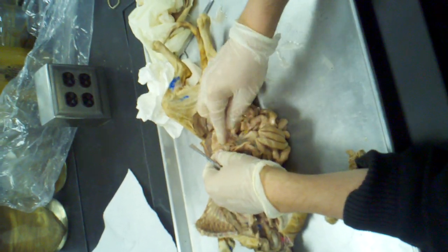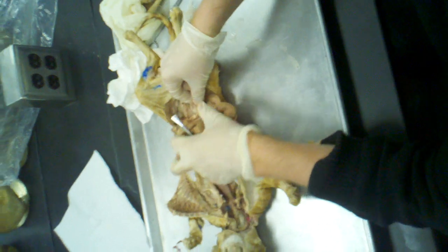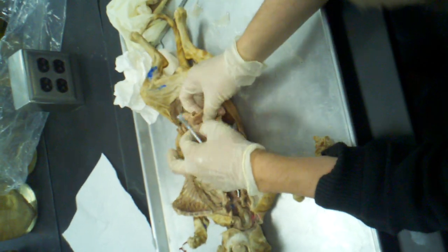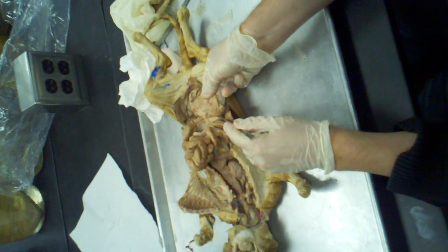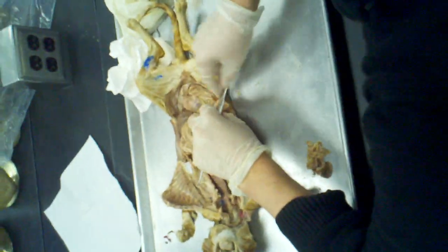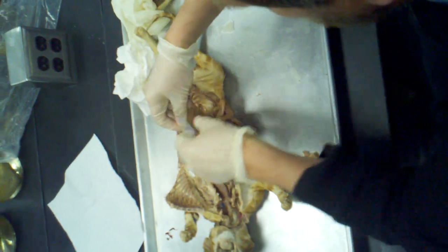Now the colon doesn't just go straight down into the rectum. The way I have it oriented, it actually should be oriented like this. So once the lesser intestine goes into the greater intestine where the cecum is, the first thing it does, it goes back up just a little bit. So this part here, where it goes back towards the head, is known as the ascending colon. Then it makes a curve to the other end of the body, which in this cat it doesn't do. But this part here, where it has gone up and goes sideways, that's the transverse part.